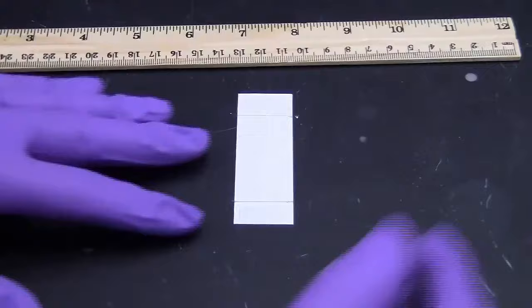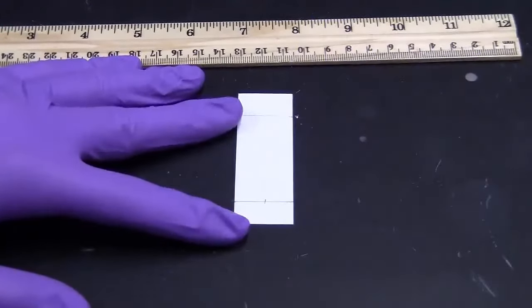Next, make a small tick mark in the center of the start line. You will need a tick mark for each sample.